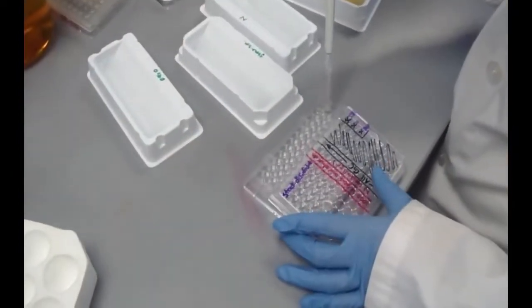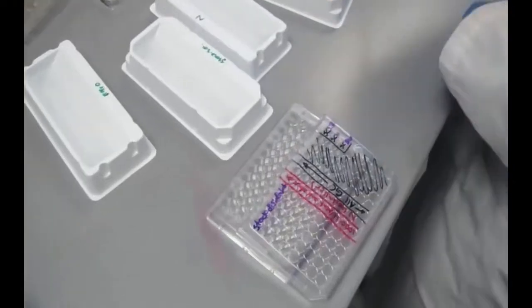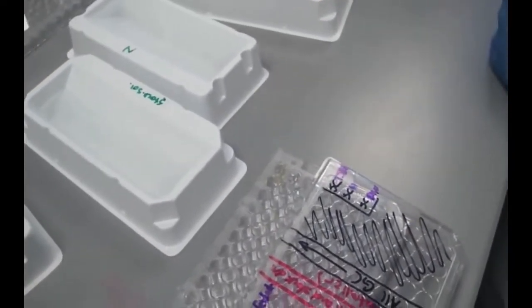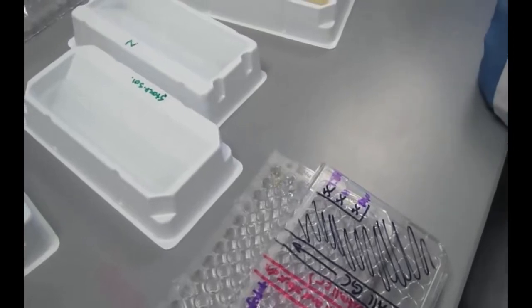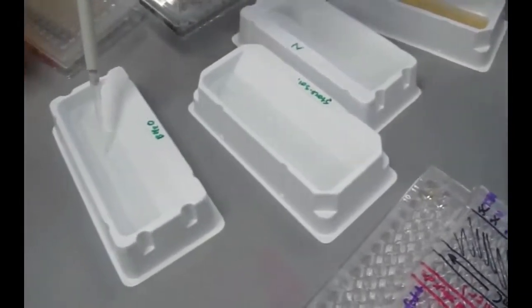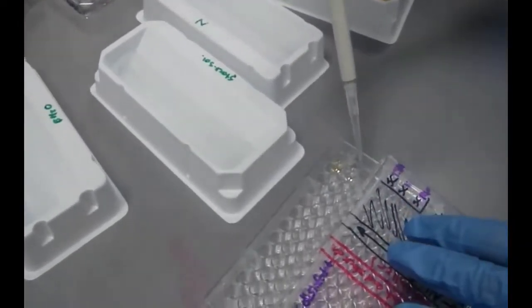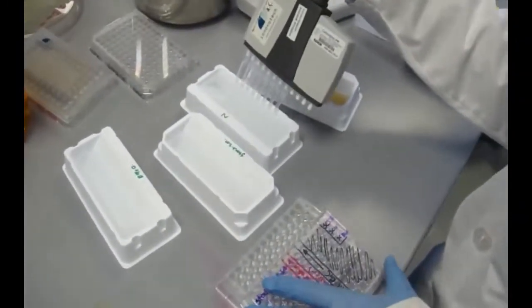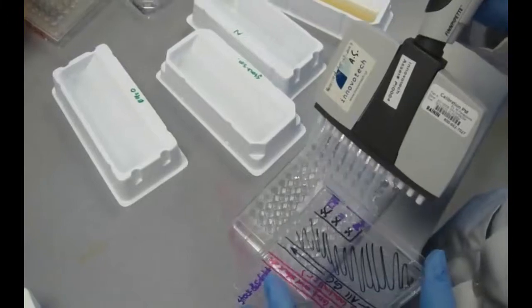The challenge plate is prepared by diluting disinfectant stock solution to the appropriate concentration in each well. These are sterility, neutralizer, and neutralizer effectiveness control wells. The challenge plate must be freshly prepared the day of the challenge and used within 30 minutes.